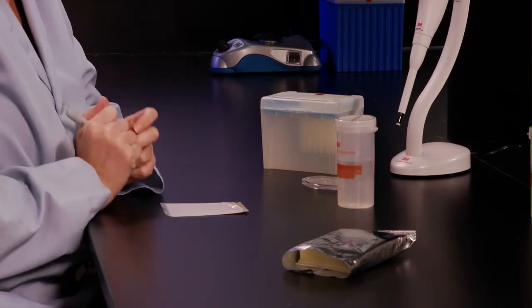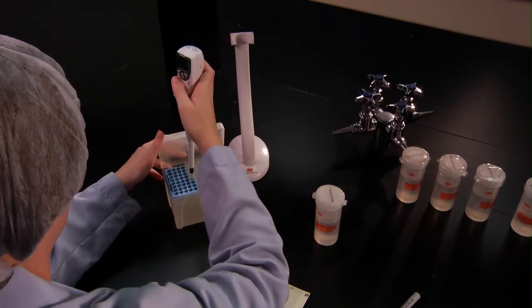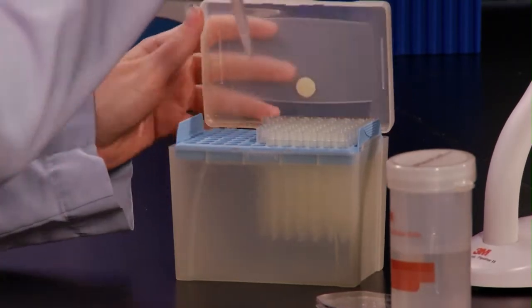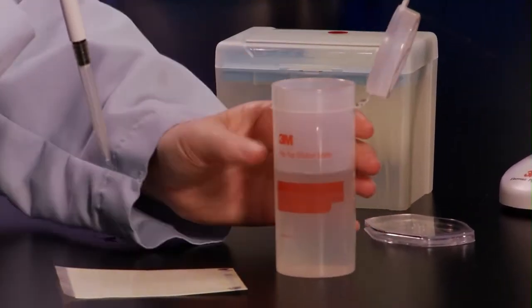Then, attach a tip to your pipetter. We're demonstrating with 3M's 1 milliliter electronic pipetter and tips, a pre-programmed instrument for diluting and pipetting onto 3M PetriFilm plates.